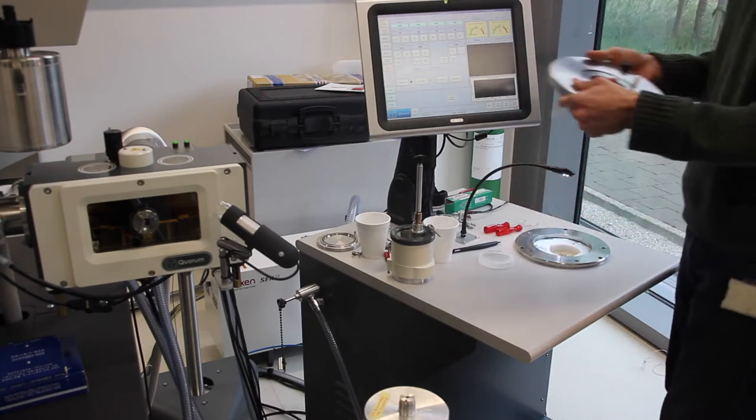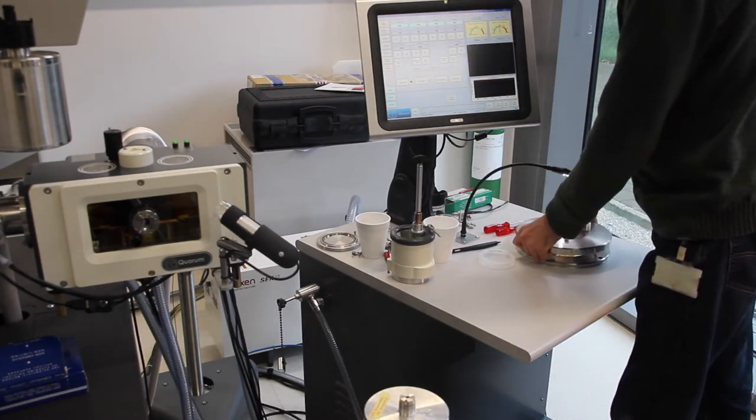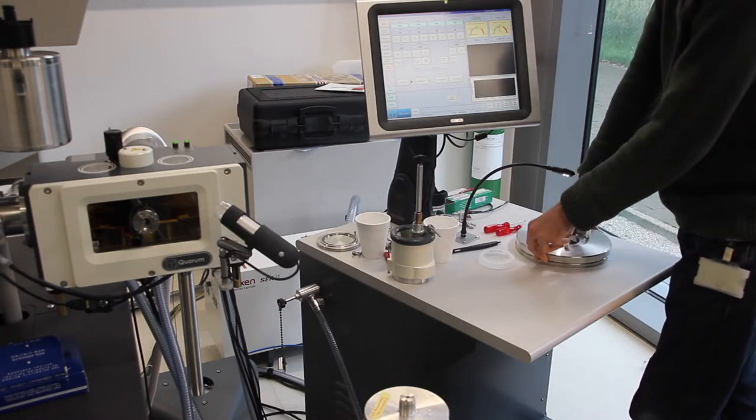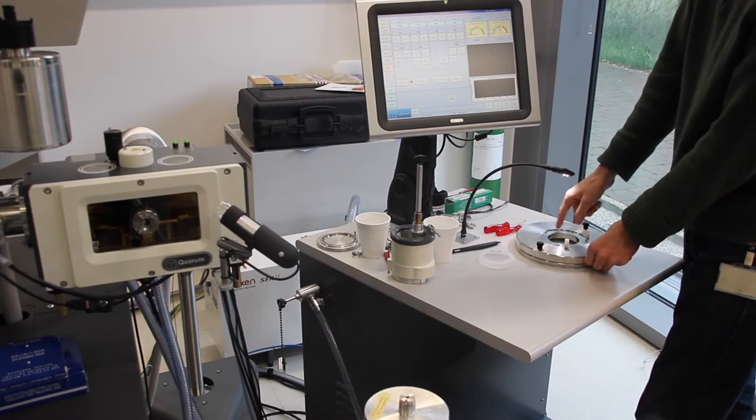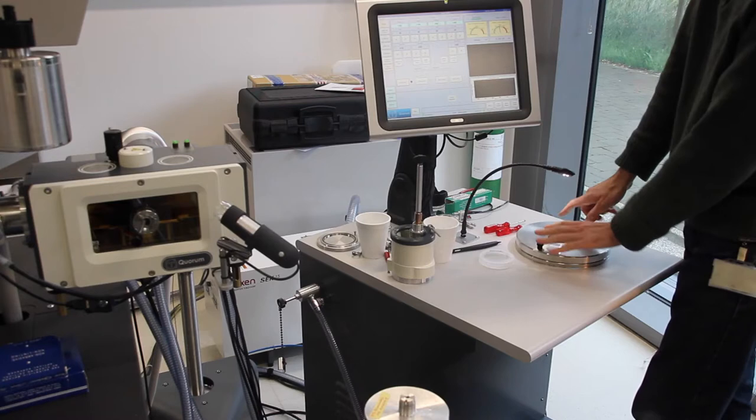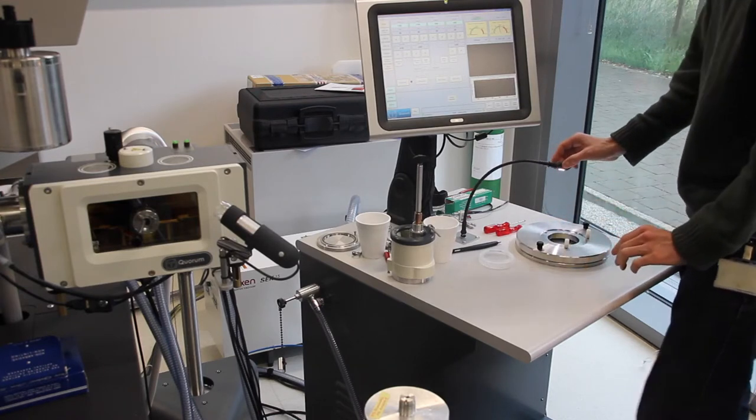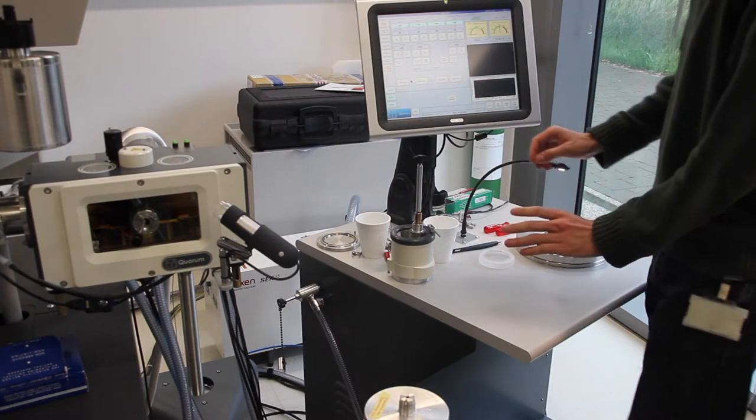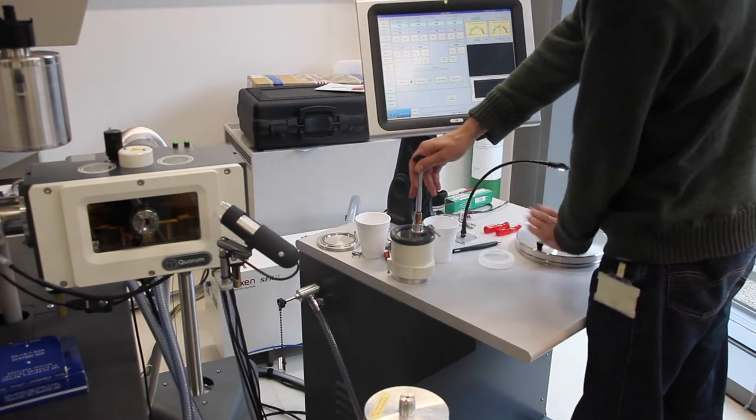Next, we will add on the well cover. Just be careful, it has a little insert that goes into the transfer box, and sometimes this doesn't line up correctly, so you might just have to wiggle this and push the box forward a little bit when you're putting this whole apparatus in.